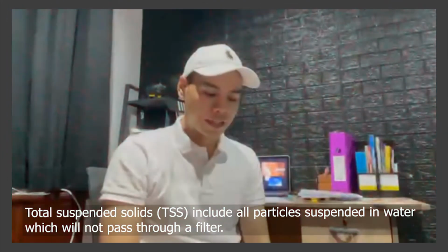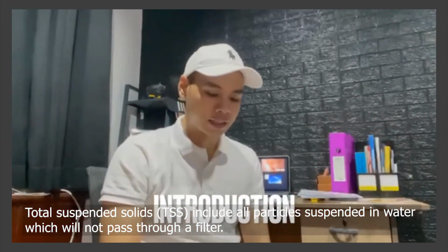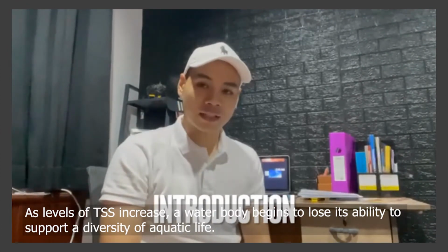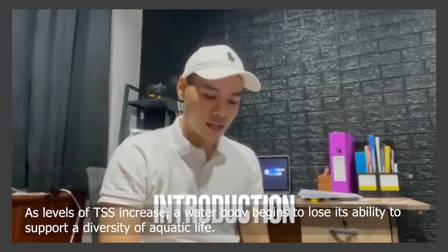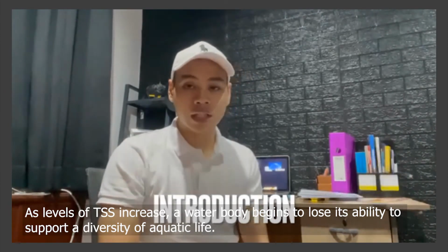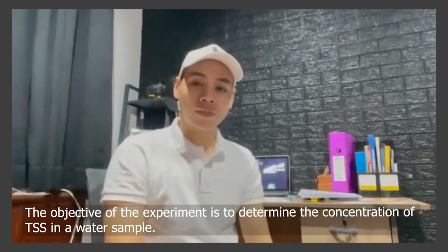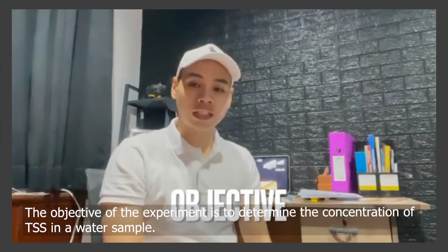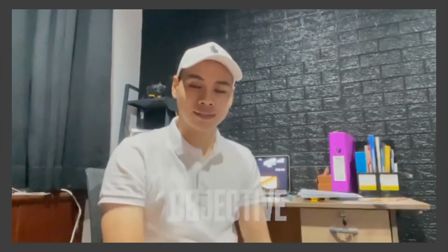Total suspended solids include all particles suspended in water which will not pass through the filter. As the total suspended solids increase, a water body begins to lose its ability to support a diversity of aquatic life. So the objective of this experiment is to determine the concentration of total suspended solids in the water sample.